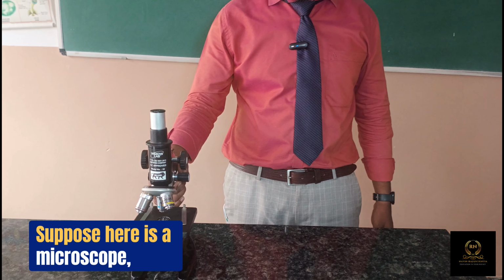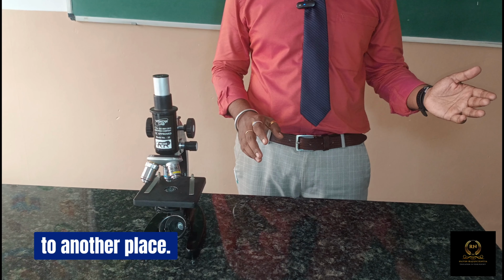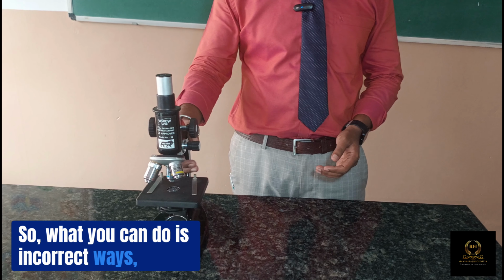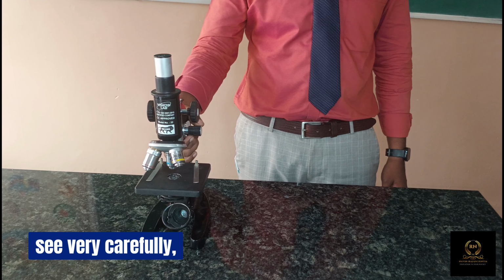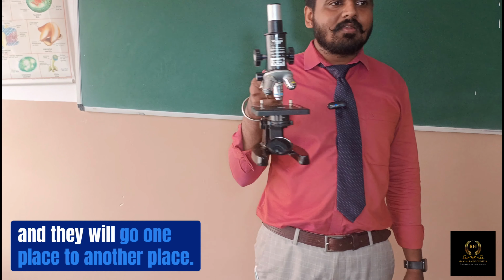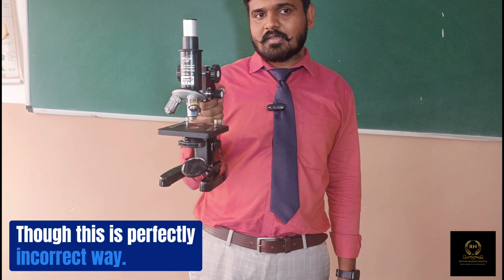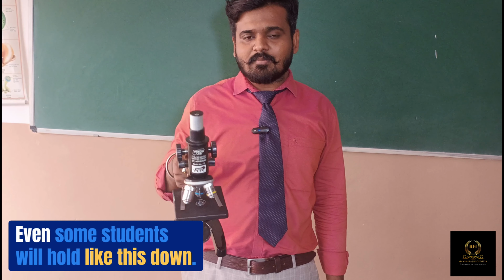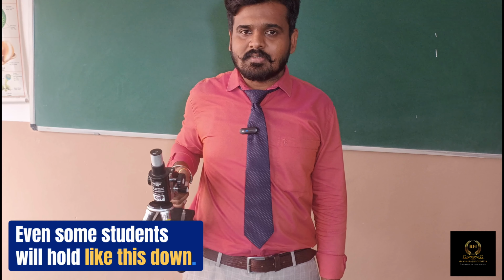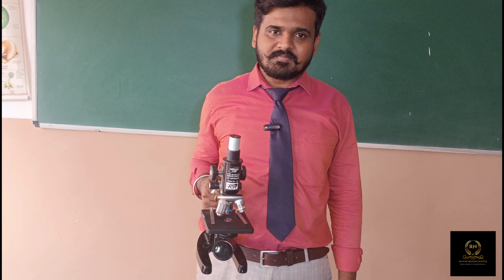Suppose here is a microscope, and you want to take it from one place to another place. See very carefully. Many students will lift the microscope like this and go from one place to another. This is a perfectly incorrect way. Even some students will hold it like this, down here. This is also an incorrect way.